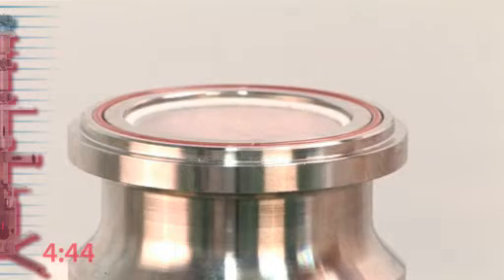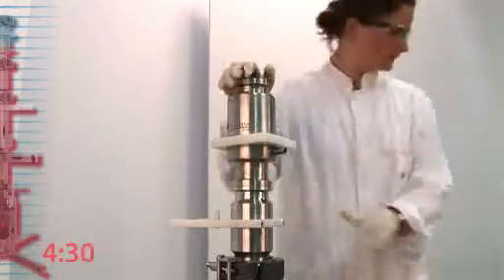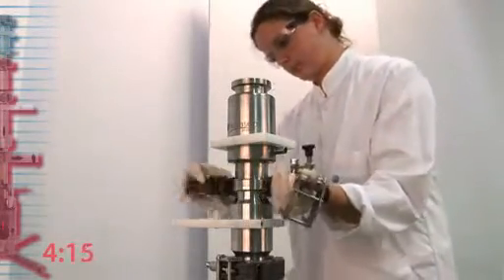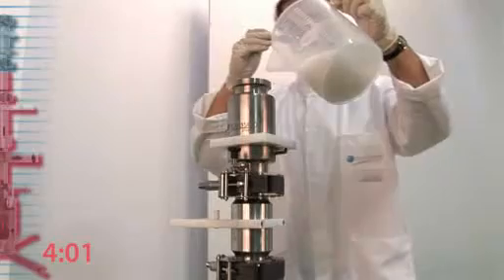We first fix the column to the packer. Second step, we adjust the flange and fill the column.